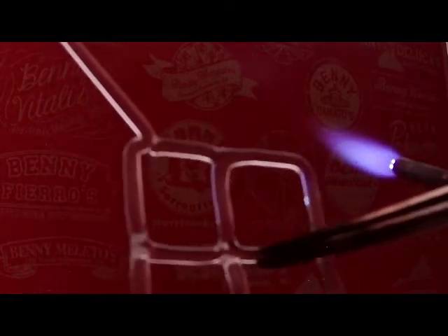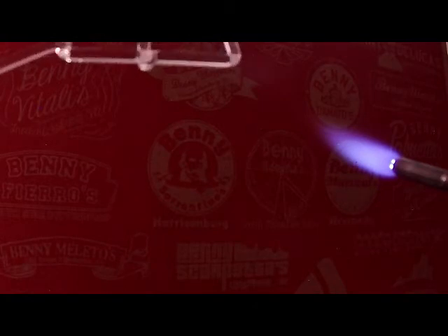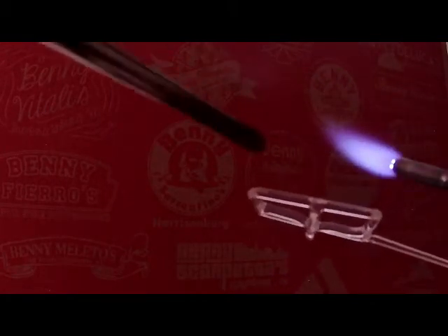I'm bringing it out of the flame, rotating it, and taking a look at how uniform it is. And it looks pretty good. I could keep fussing with it, but I think I'm okay. So now what I'm going to do is come back and fuss with the corners, especially like this right here.